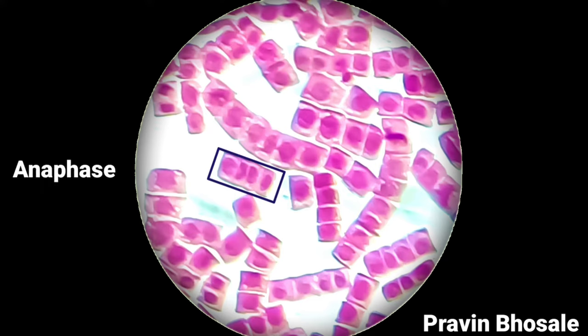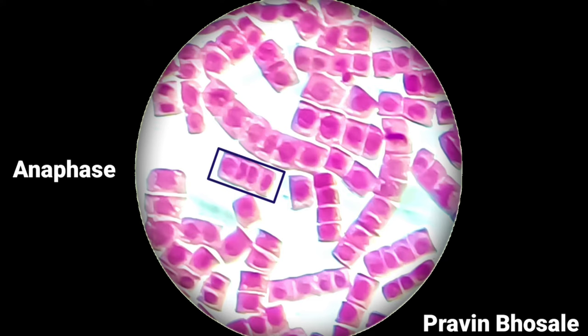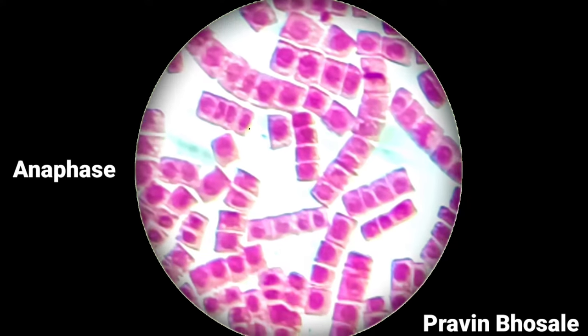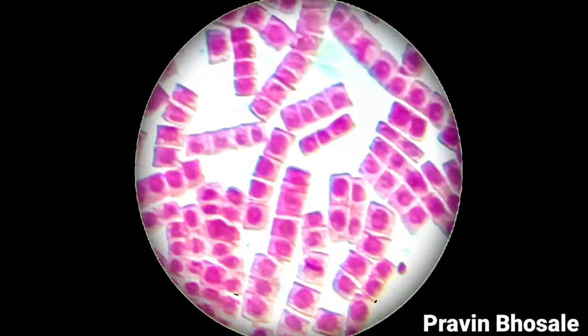Here you can see anaphase in both the cells. The sister chromatids are moving towards the opposite pole.